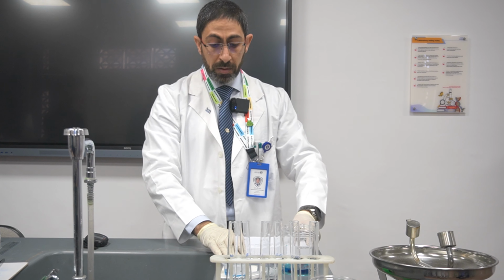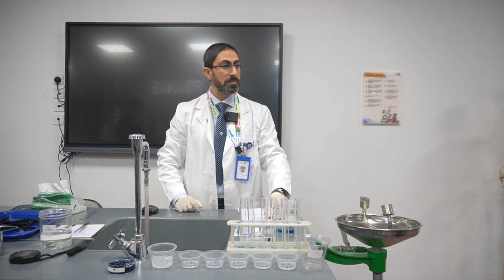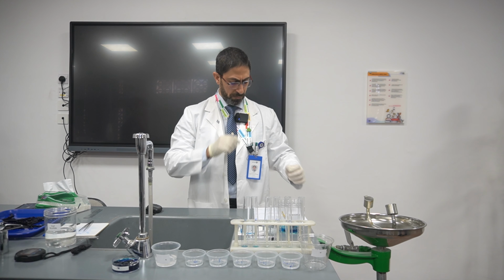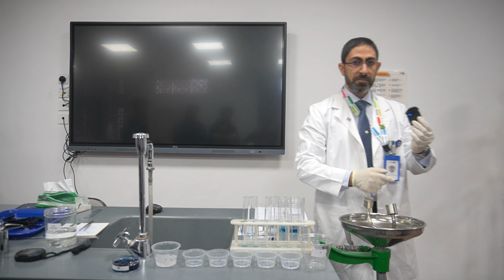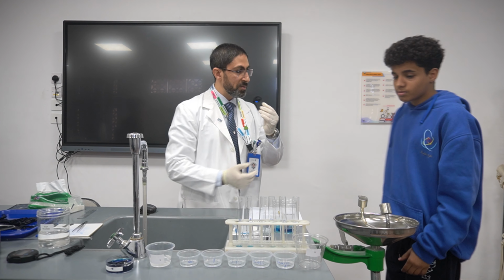So what do we conclude from this experiment? Higher salt in a solution will cause it to give higher intensity of color.